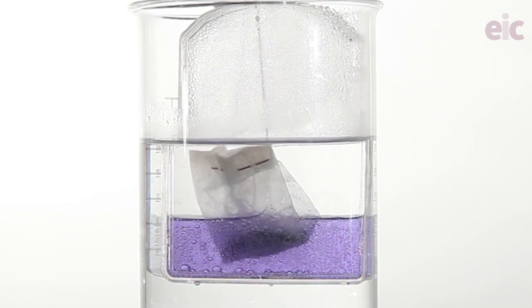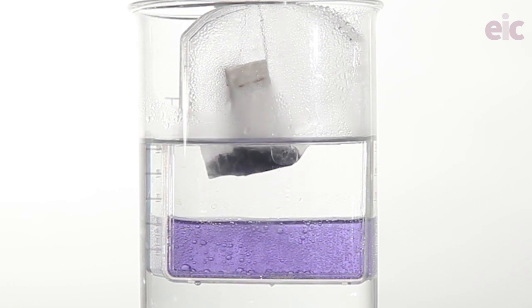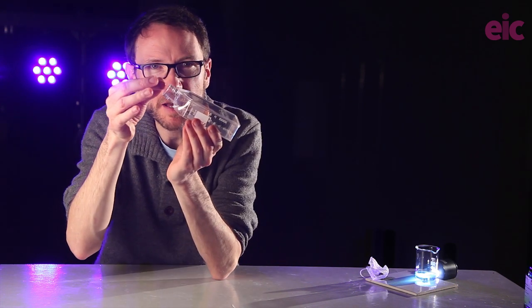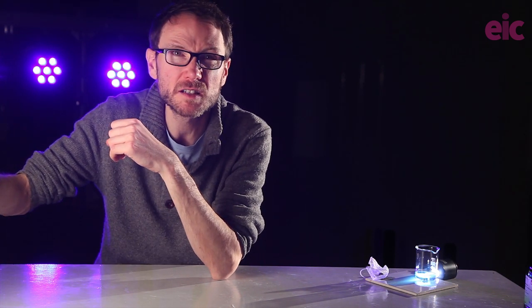Removing the tea bag now needs to be done quite carefully. The more concentrated acid solution that we're using definitely weakens it a lot faster. So I tend to tilt the culture flask on its side, carefully pull the bag out with a washing up bowl underneath to catch anything that sort of breaks on the way out. Goes without saying that you should remove the bag as soon as you've convincingly reached vanadium 2.